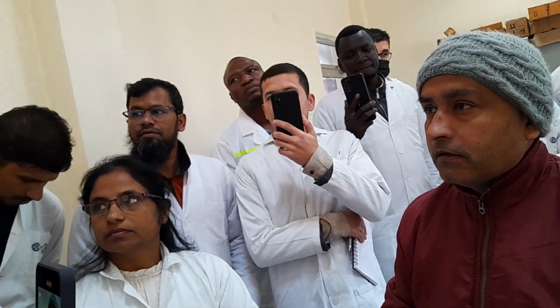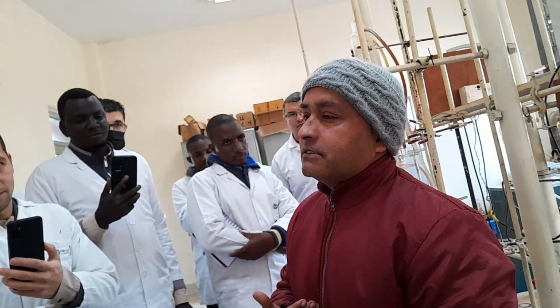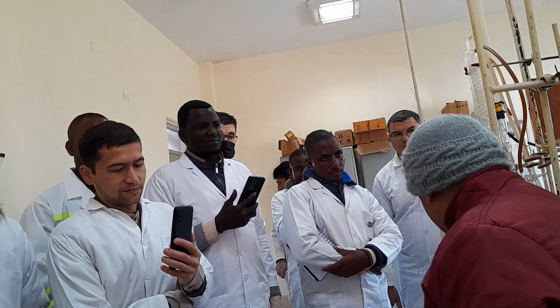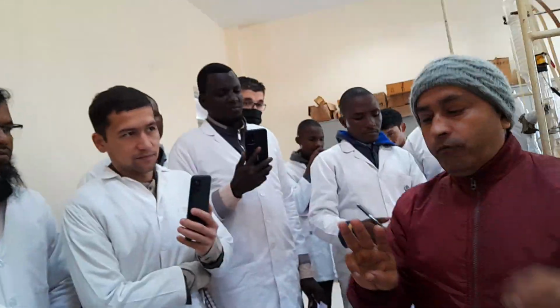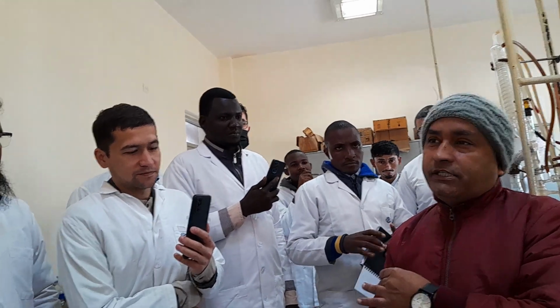Does not meet, does not comply with what they need. As far as my experience is concerned, I have 18 years of experience. So far, I did not find any difference between our report and the refinery result, because here I am taking a minimum of 1.5 liters of the sample and distilling it thrice. We are doing the distillation of the same crude oil 3 times, and the two that match are the ones we send to the refinery.